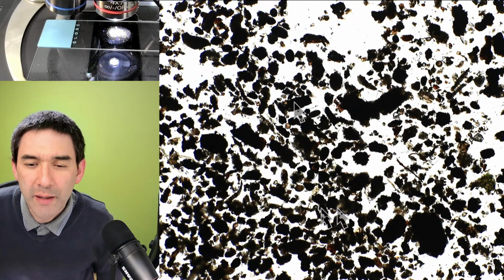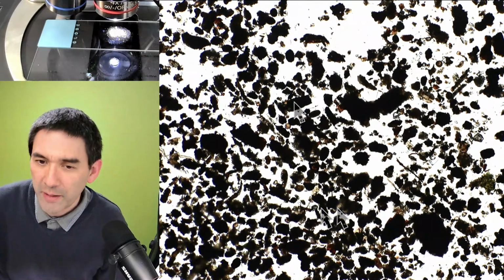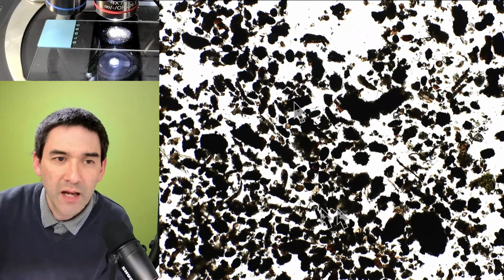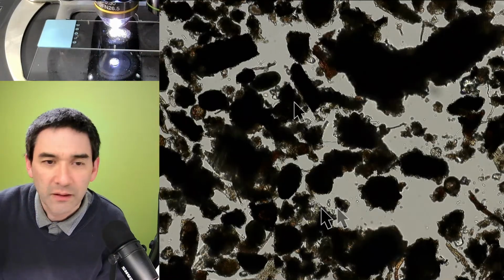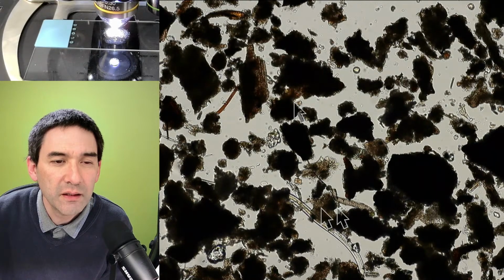Yeah, 120 micrometers to 660 micrometers. Yeah, so essentially I had 120 micrometers. Thank you for the research. So you see that with this one, I was at the lower end. Yeah. So that's basically the thing here.